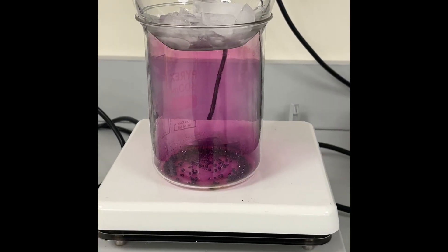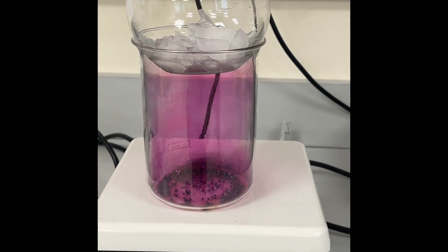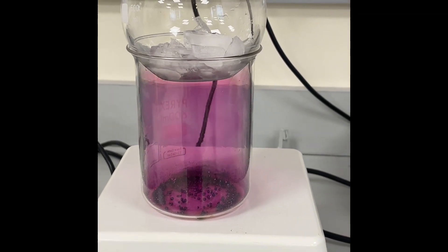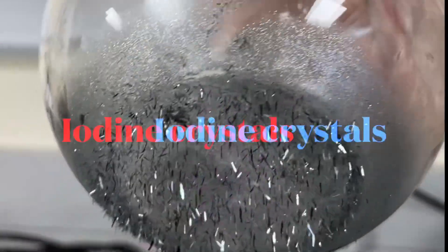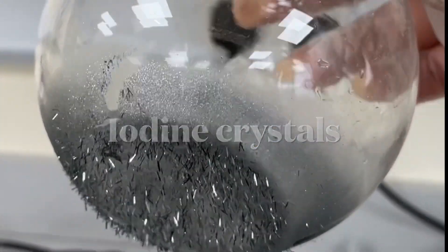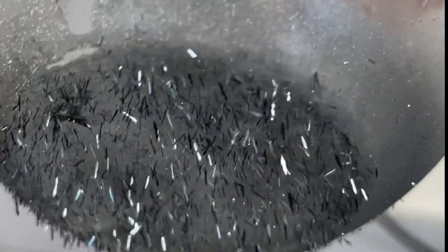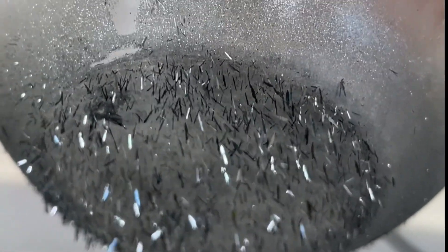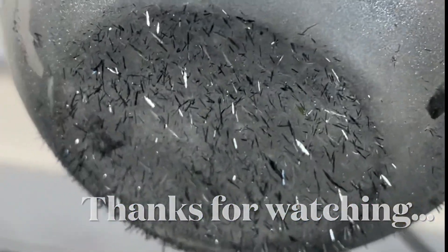You can now see that the beaker has almost turned purple in color because of the vapors from the iodine. You can also see that crystals have grown on the surface of the round bottom flask due to condensation from the vapors. That's all about sublimation — take care, till we meet next time, thank you.